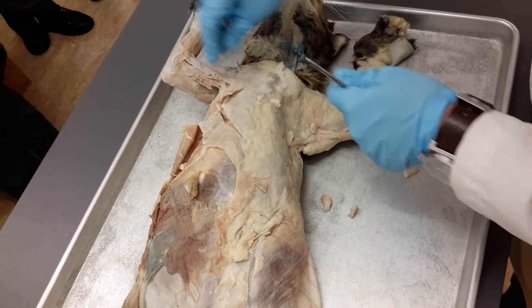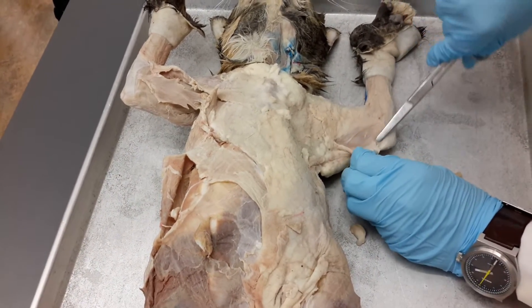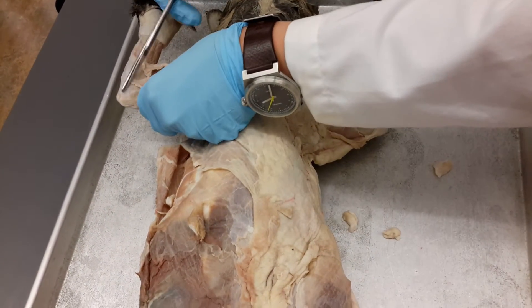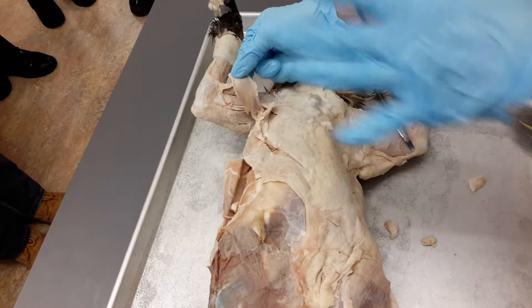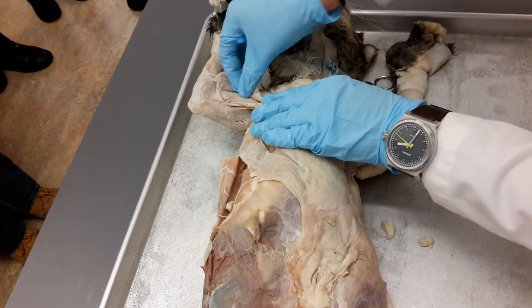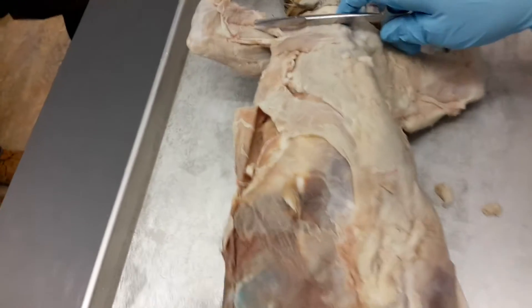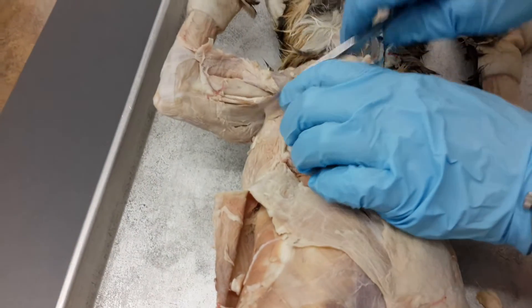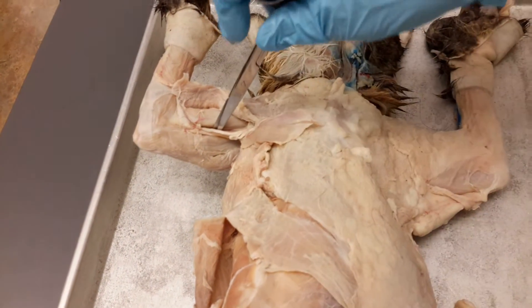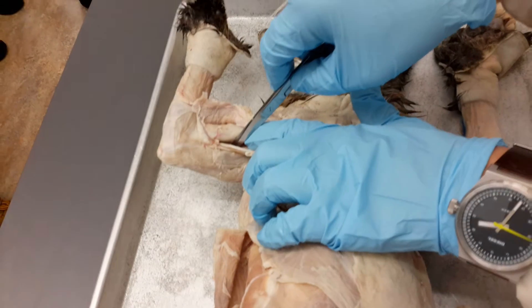For the arm, there's a really thin muscle that you're going to have to tear off. What I did is I came towards the elbow and just pinched the connective tissue, made a little cut, and separated it out — then I literally cut it off and peeled back this really thin muscle. Be careful because it's thin. This is a muscle we didn't cover, so don't worry about it. Once you peel that back, you'll expose the arm. So what muscle is this right here? Biceps brachii — it looks just like ours. If you see a pin underneath that muscle, what muscle is it going to be? Brachialis. So you don't even have to dissect that — just know: biceps brachii, and if you see a pin next week underneath it, brachialis.